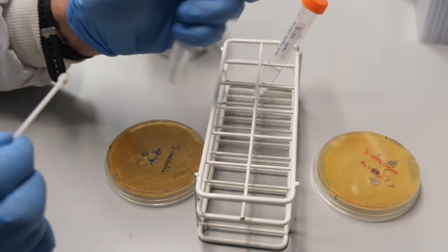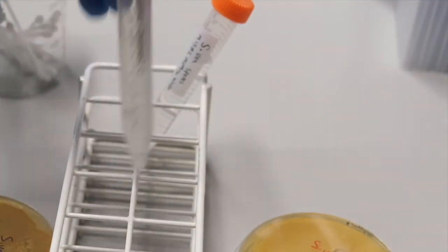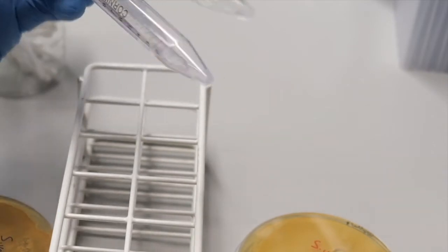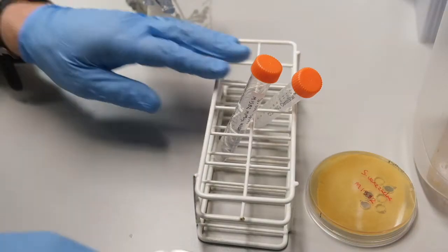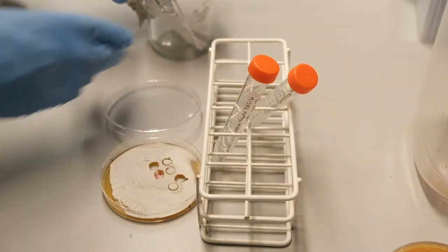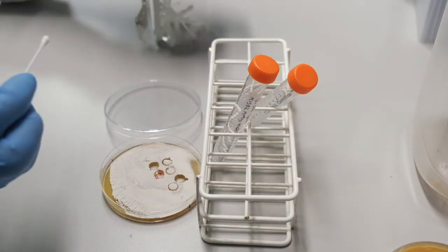We can see how our spore suspension is cloudy or turbid compared to the original 20% glycerol solution. Our M1582 spores are collected in exactly the same way.